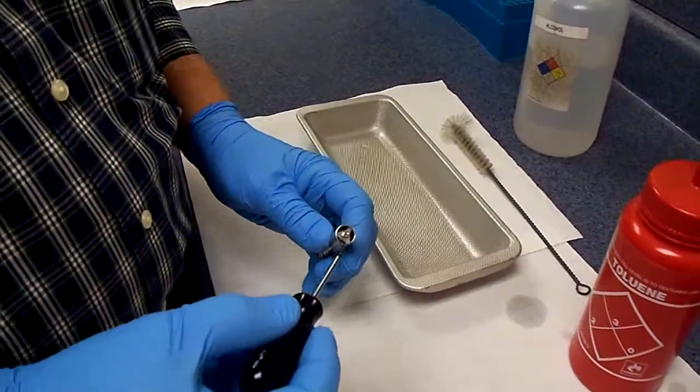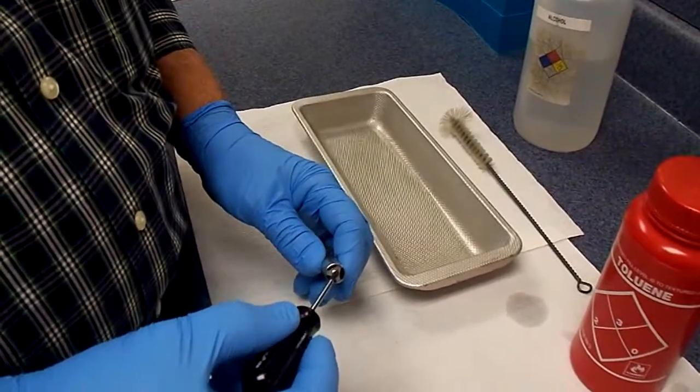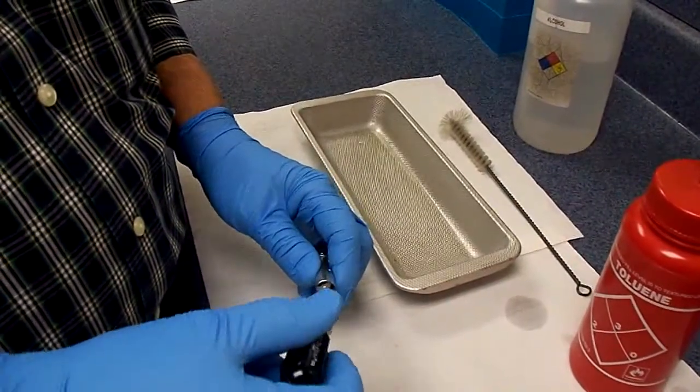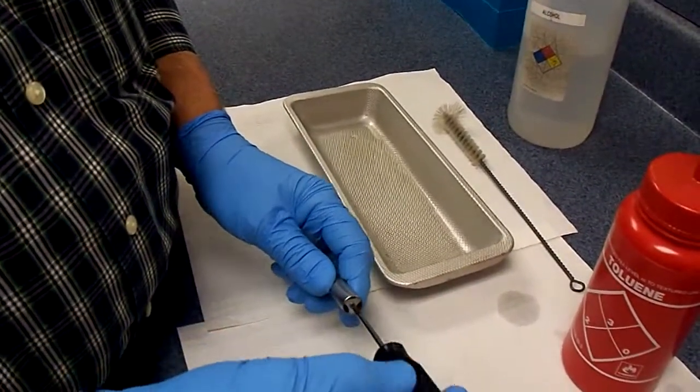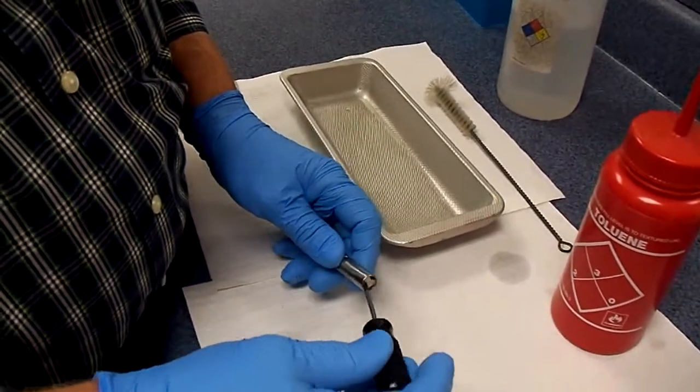This is an extreme clean for cleaning the 1152 probe. First, remove this screw from the centering washer and pop out the centering washer.